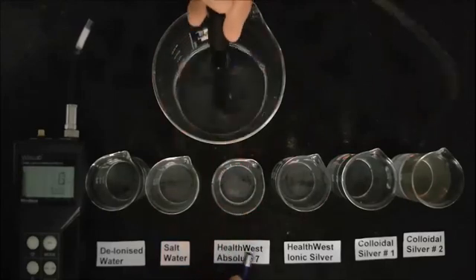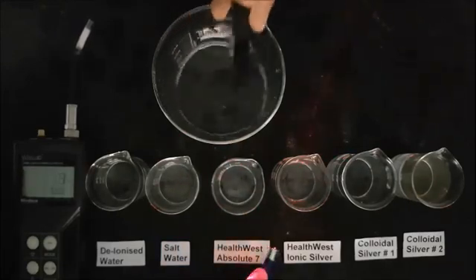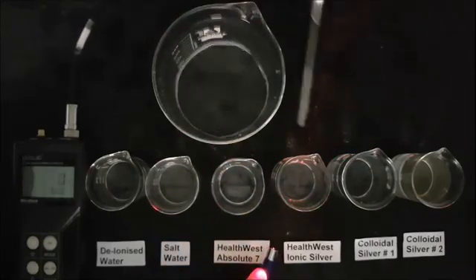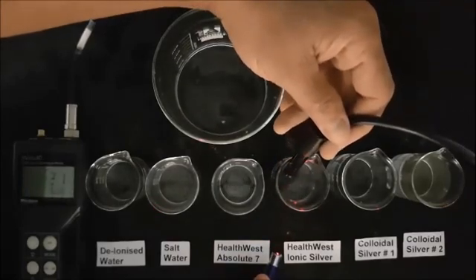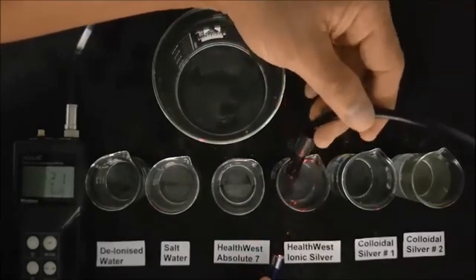In the next beaker we have Health West Ionic Silver and there is still no Tyndall scattering because all the silver is in the positively charged ionic form and again there are no impurities, particles, colloids or metals.